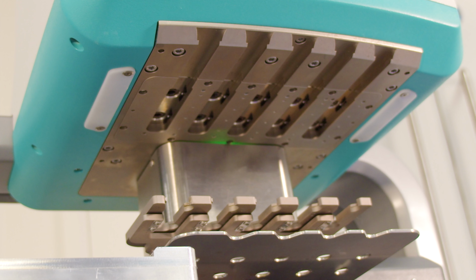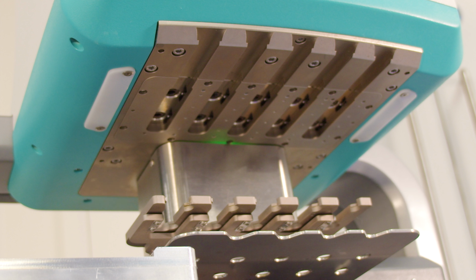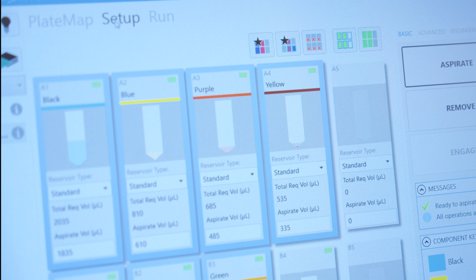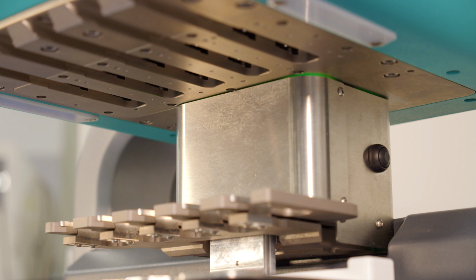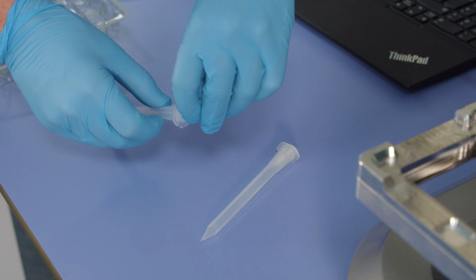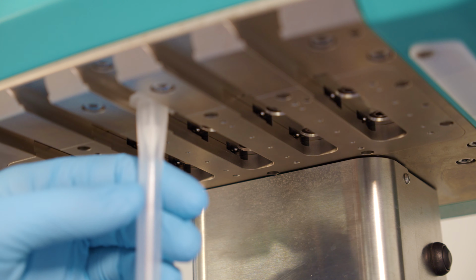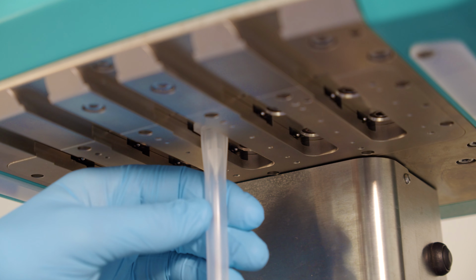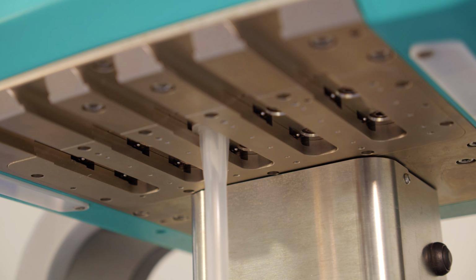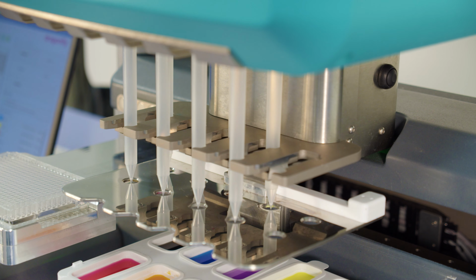First, let's attach the syringes. You'll need to place them above the positions in which your input liquids will sit, which we saw on the Setup tab. In order to load the syringes, you'll have to move the syringe guard down. To do this, press the black button on the side. Now, take a syringe and place a plunger in the top. Then, slide it into position on the Dragonfly, push it up, and rotate 90 degrees anti-clockwise until it locks. When you're done, manually lift the tip guard up until it clicks.